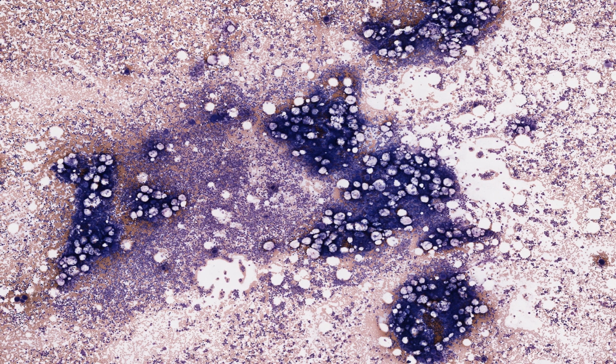Hemopoietic bone marrow has long been the most difficult tissue of the body for histologists to describe, except possibly for the brain. For years, experts made serious misinterpretations about these cells. For example, they erroneously believed that monocytes and lymphocytes were not formed here at all. As I explained earlier, I am not going to distinguish the differentiation pathways for monocytes and lymphocytes in bone marrow.